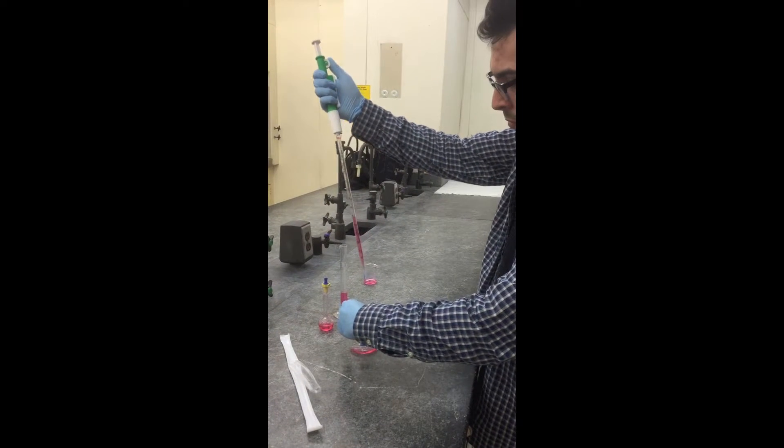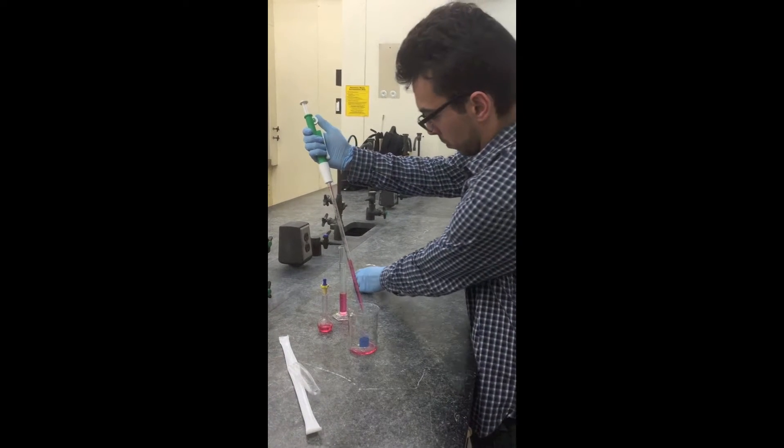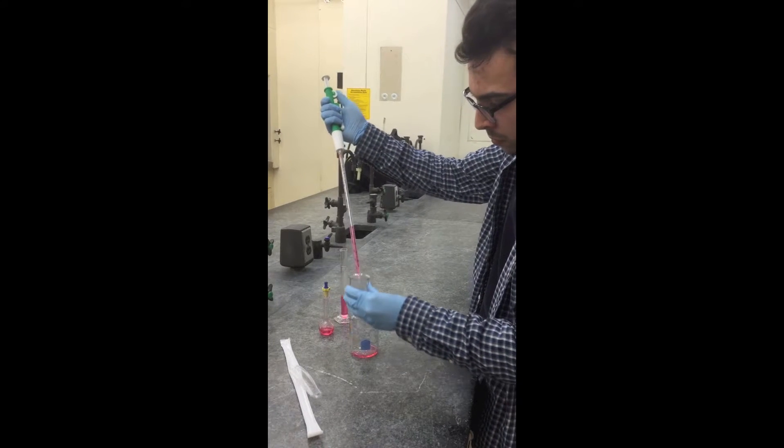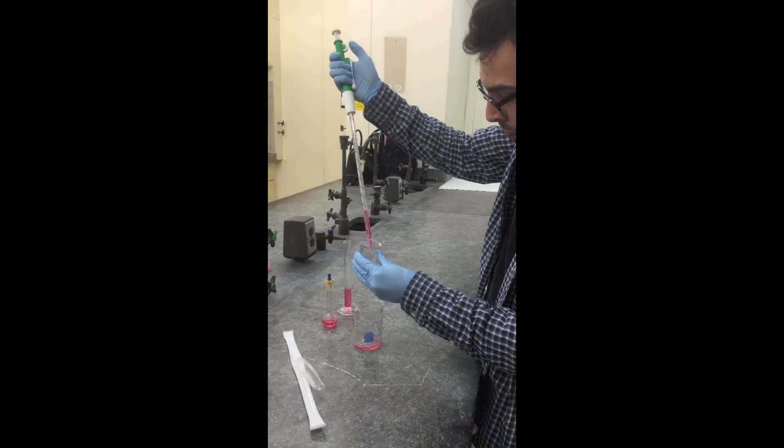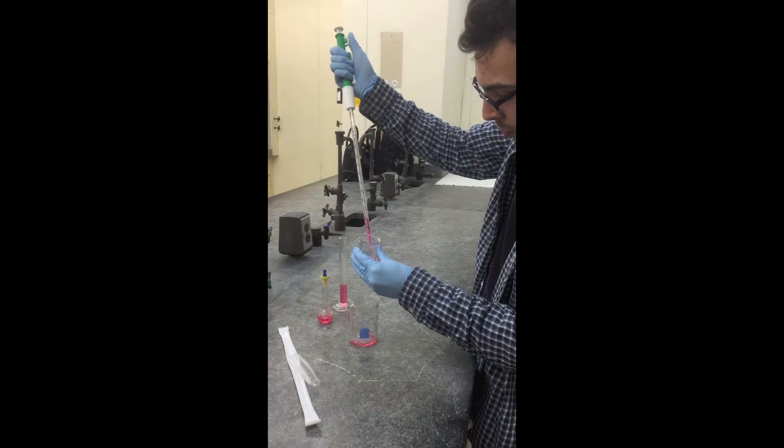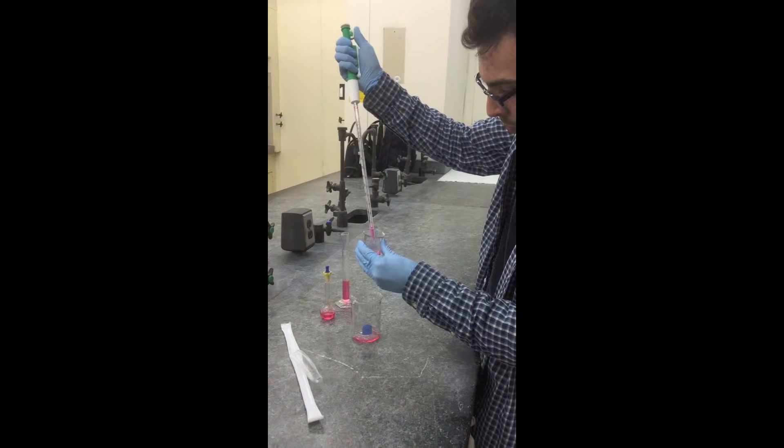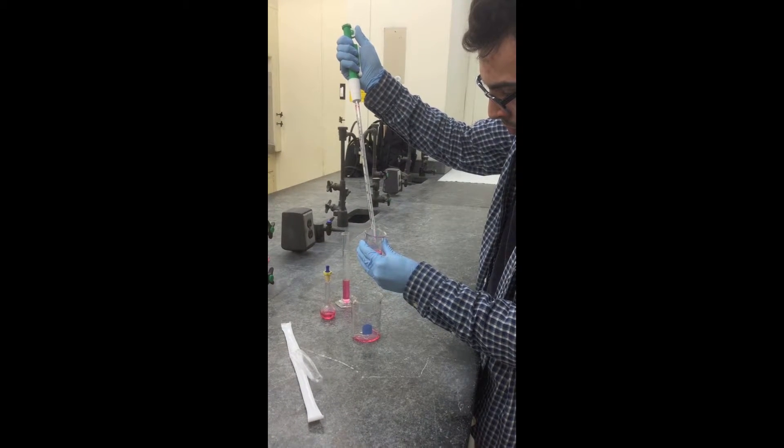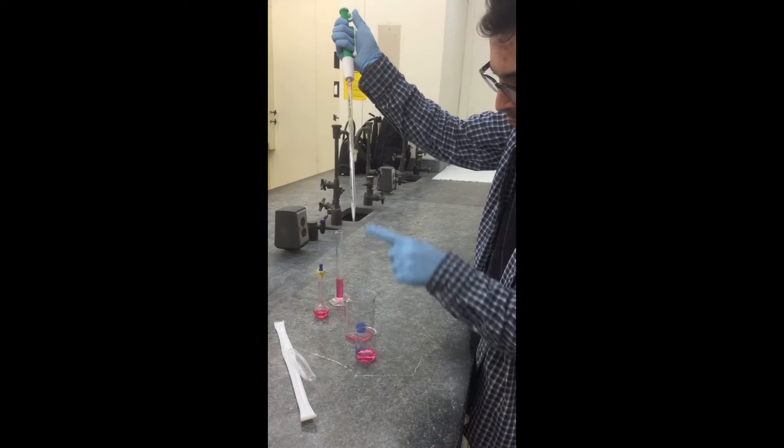Draw the liquid up into the pipette using the knob. When the appropriate amount of liquid has been drawn into the pipette, dispense it into the appropriate beaker or container.